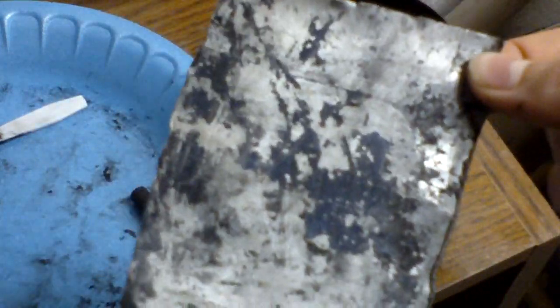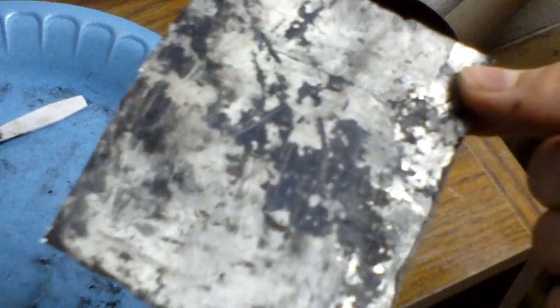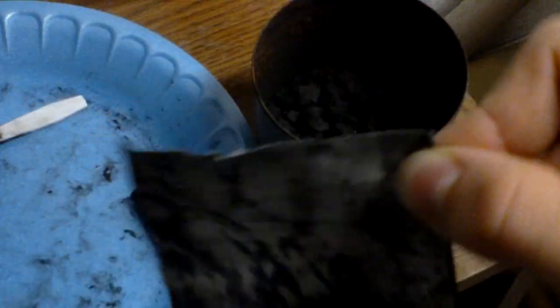Then I got a zinc metal sheet. It's about four inches by three inches. You can cut it, make electrodes, melt it, whatever. It weighs about 15 grams.